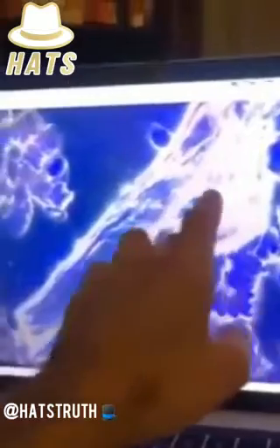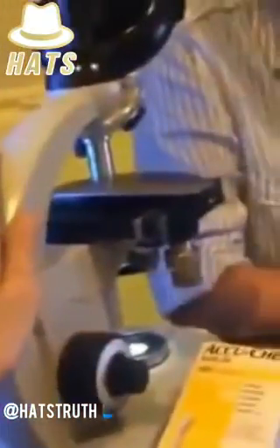He's got, what is it called? Electron microscope, which allows him to test the actual substance, to see what it is, what it's made out of. So he doesn't only have micrographs, but he can actually test what this is. Again, this is unknown. Dr. Peggy doesn't know what that is because she only has this at this point.